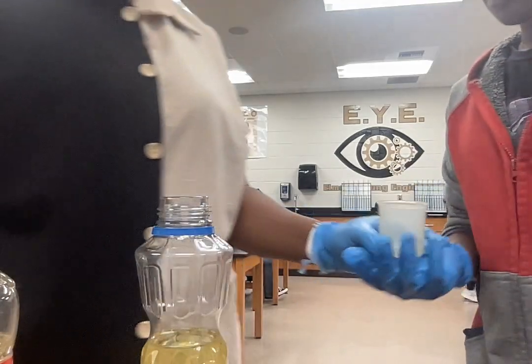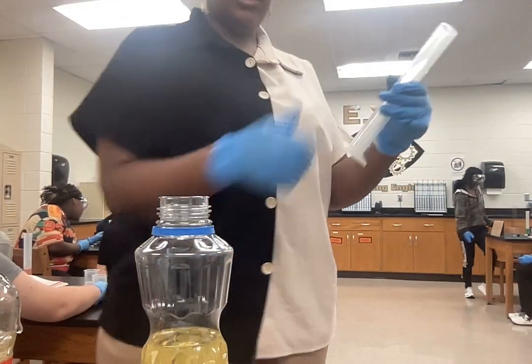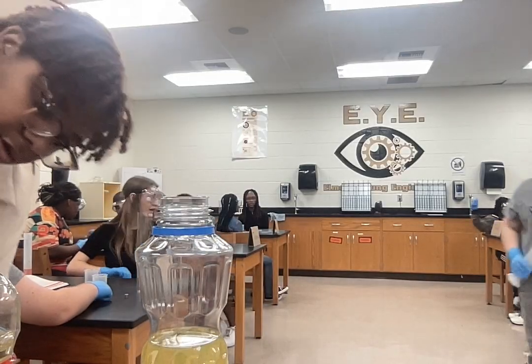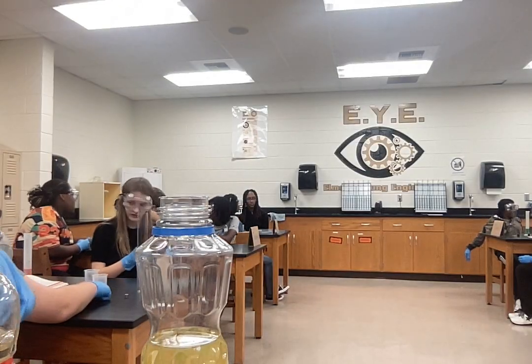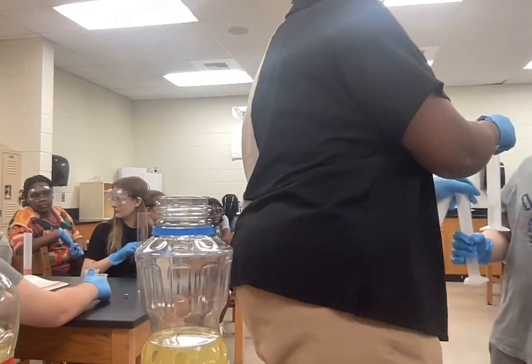Okay, there we go. All right, can I have Tanner's group come up? Tanner's group. And we're going to need all the graduated cylinder guys, so you can come on up. Hey guys, we need all 4 of the graduated cylinders, so let's go. Oh, keep the water.